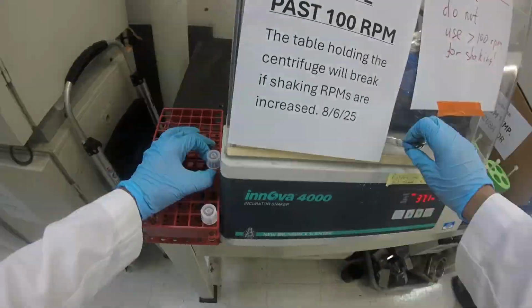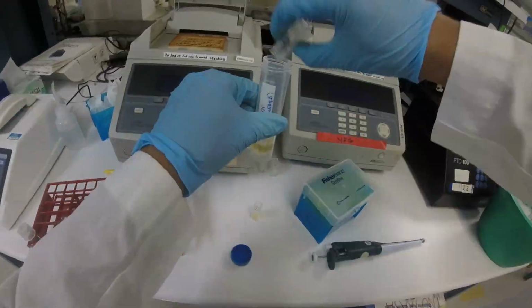I had all these plans, like, okay, I'm going to make more competent cells, I'm going to do all this, but I just didn't have time because I felt rushed. So this is one of those things where it's just a suboptimal use of my time because I'm babysitting this experiment. So I've been thinking about how we can improve that.